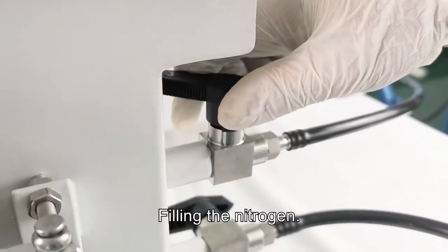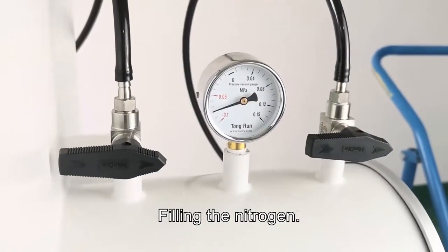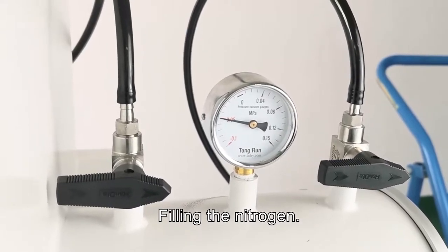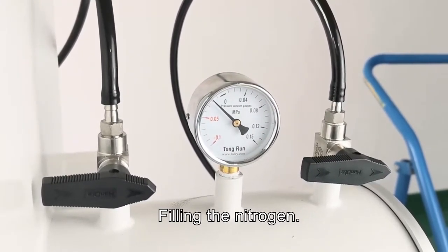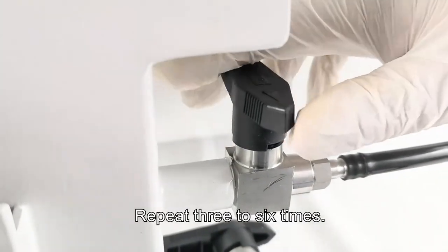Filling the nitrogen. Repeat three to six times.